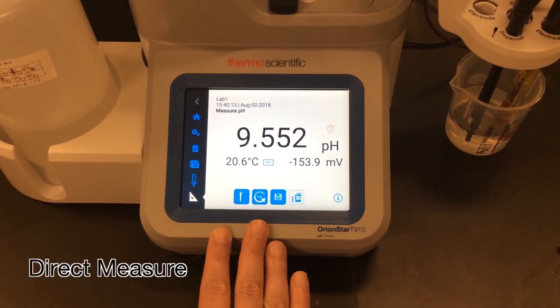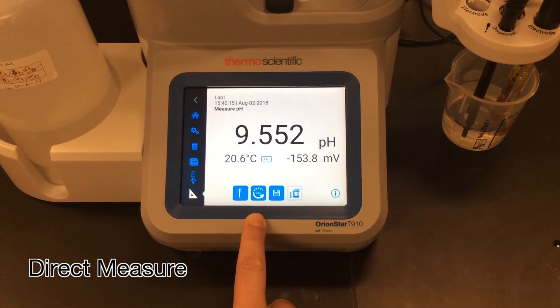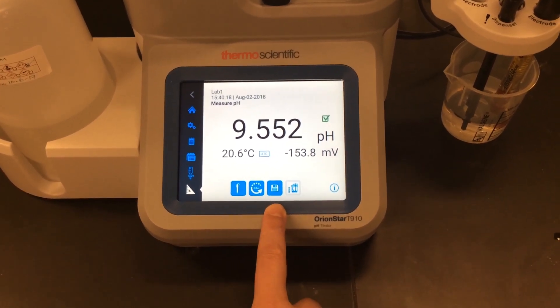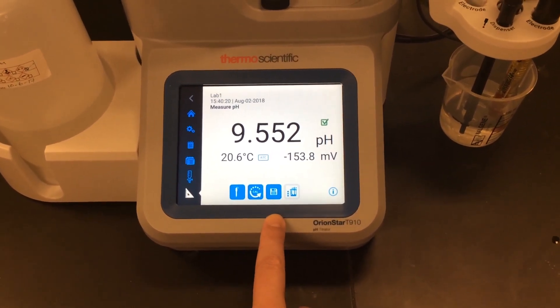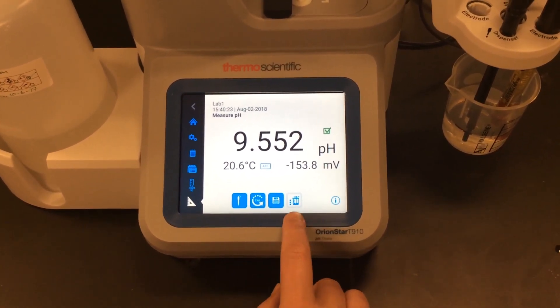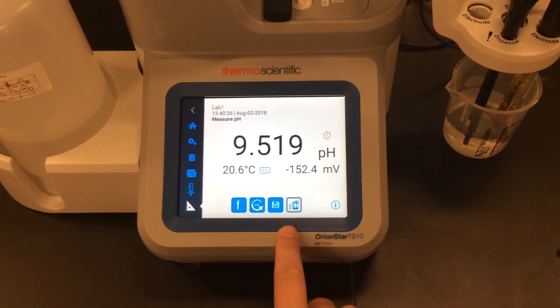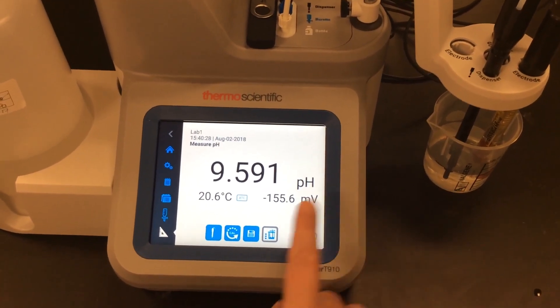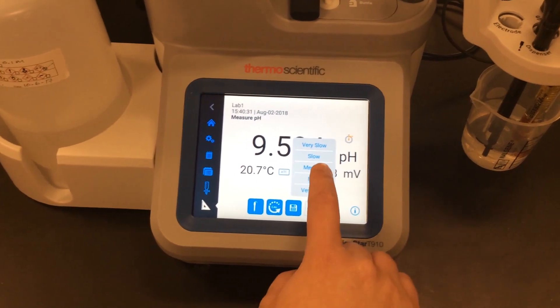The last screen is the direct measure screen. If I want to take a quick pH reading of my sample before I do my titration, I can do so here. I can also perform my electrode calibration and save my direct measurement in case it's important for my titration results.